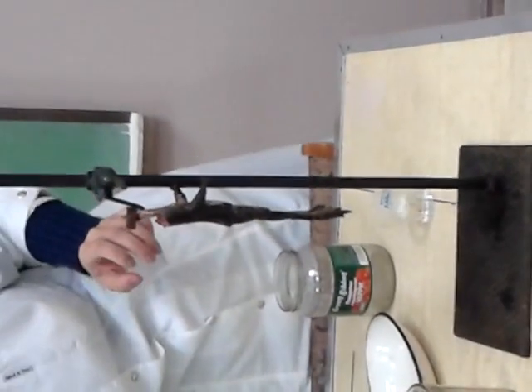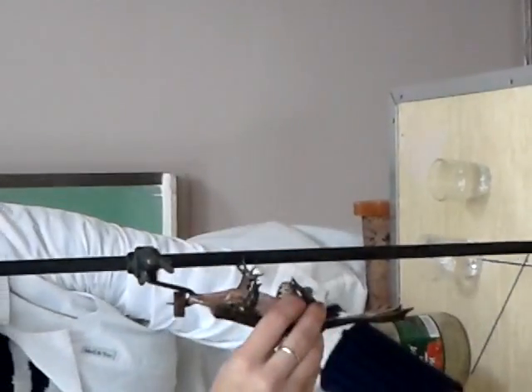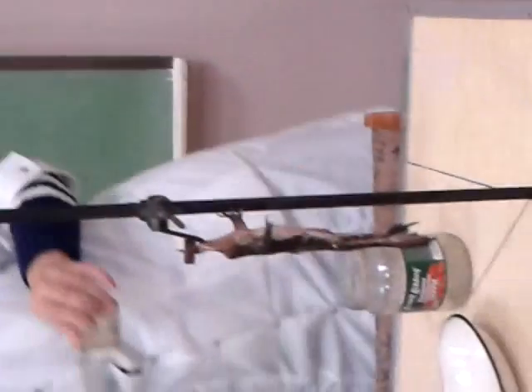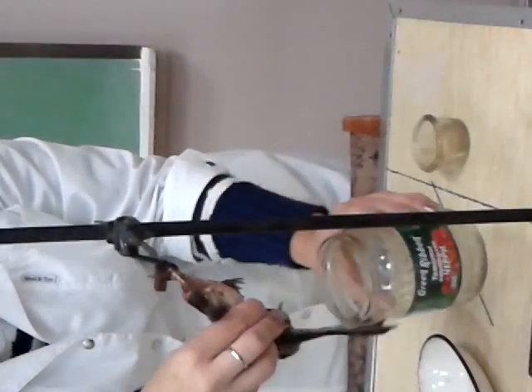Next concentration: 0.3. You ready? Yes. On? Out? Not very good. How many? 3 seconds. 0.5. 1.1 seconds. On? Out? 2.9 — 0.9 seconds. There's 3 seconds.